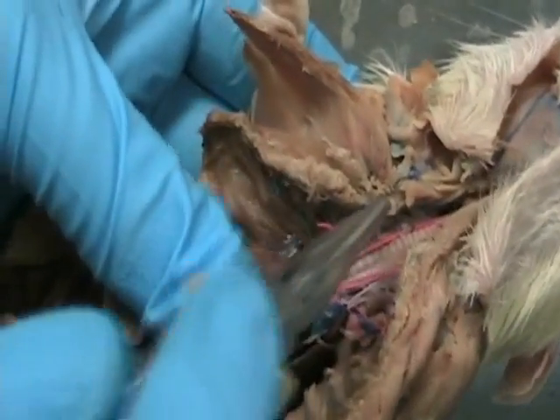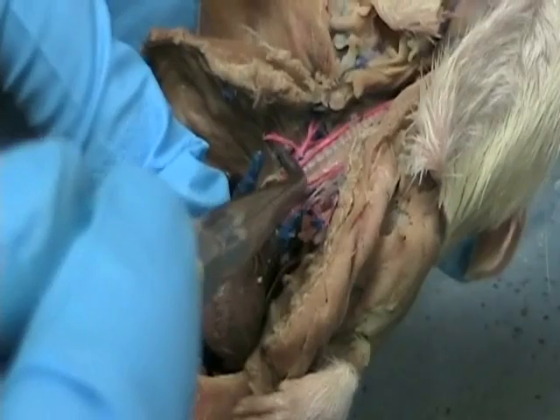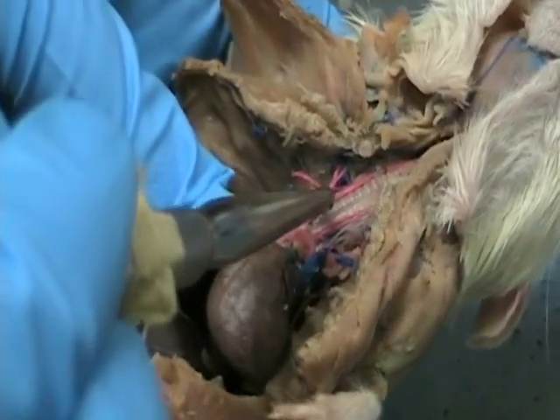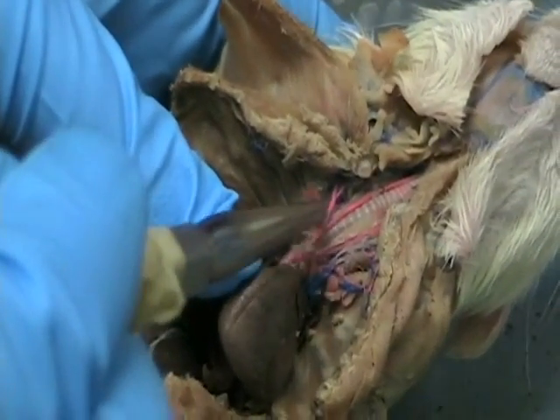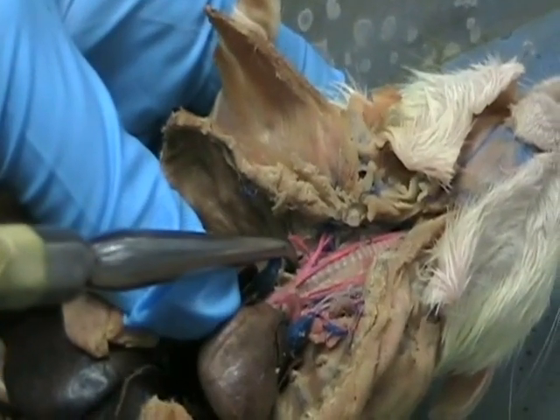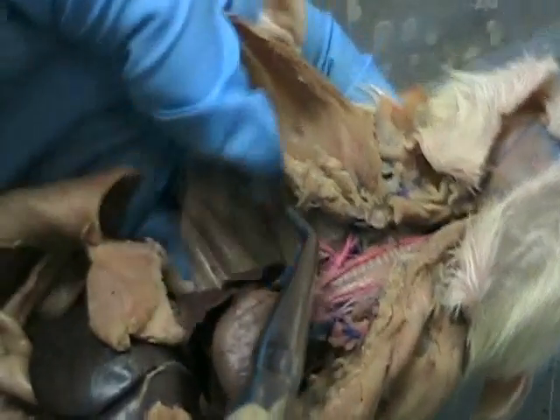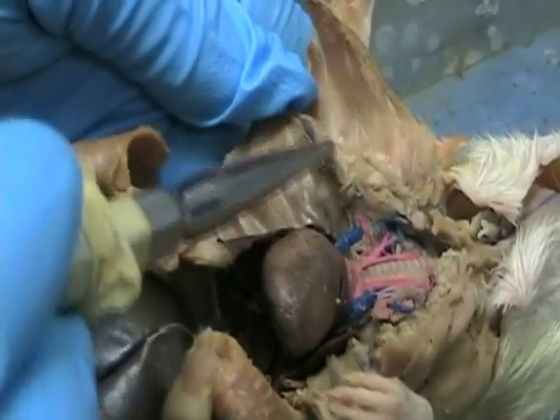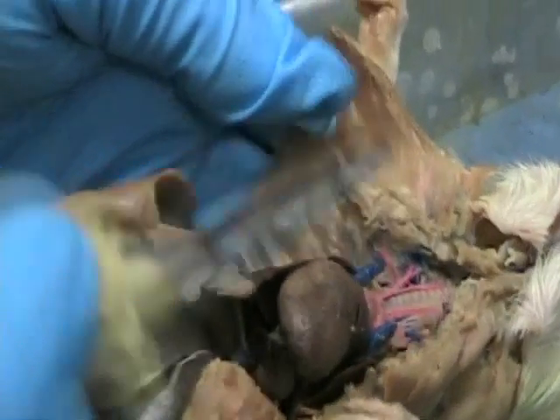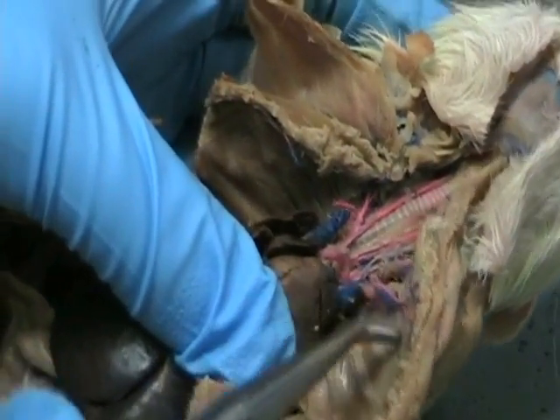Now off of the subclavian, you're going to get a couple of branches. First one, actually there are two that kind of come off of the same general area, but one comes out towards you, and the other one's going to go down and away from you. Okay? The one that's coming out towards you is going to insert, and there's the rest of it right there, into the internal wall of the thoracic cavity. This one still has it fairly intact, although it's about to break.